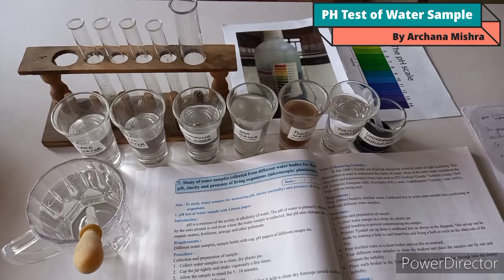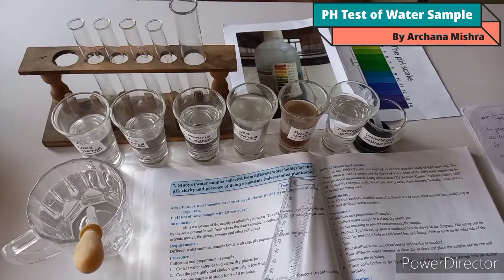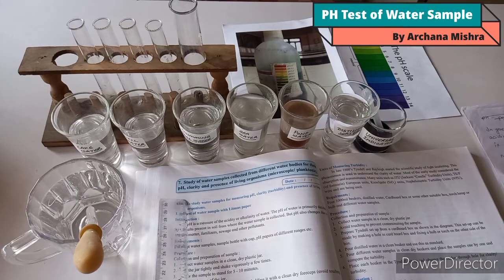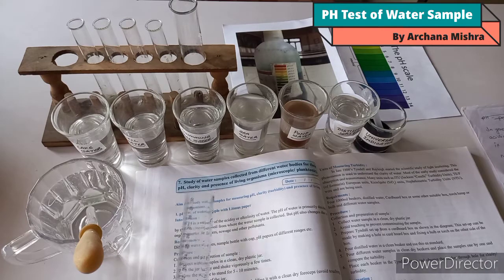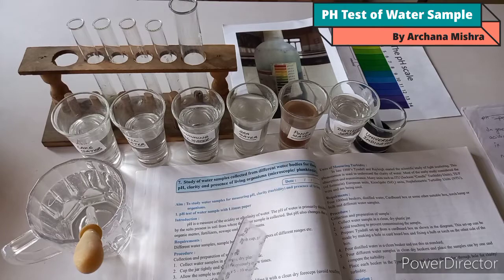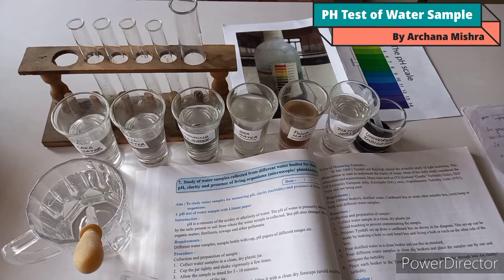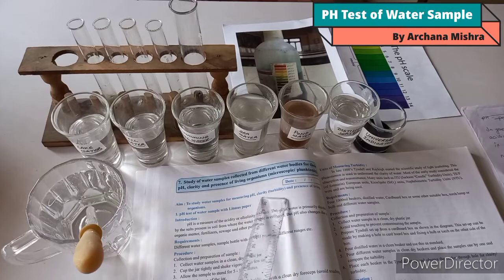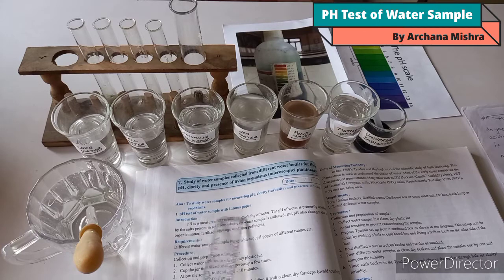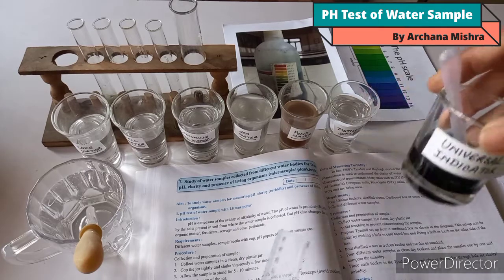Hello students. In today's session we are starting with the next practical: study of water samples collected from different water bodies for their pH and clarity. pH stands for potential or power of hydrogen — a scale used to specify the acidity or basicity of aqueous solutions. Acidic solutions are measured to have lower pH values than basic or alkaline solutions. Our today's aim is to study water samples for measuring pH and clarity, using a universal indicator.